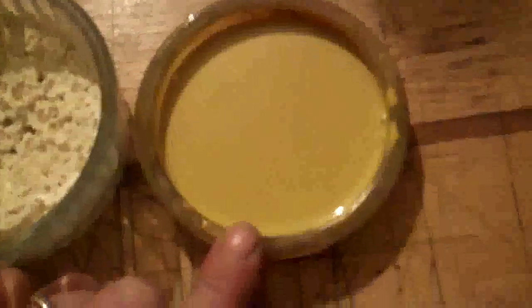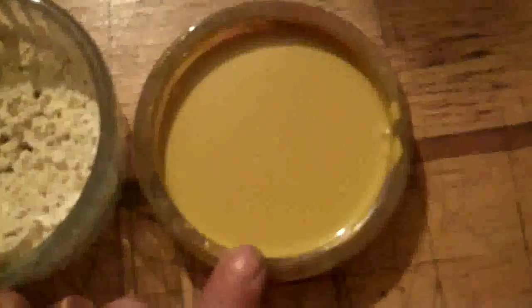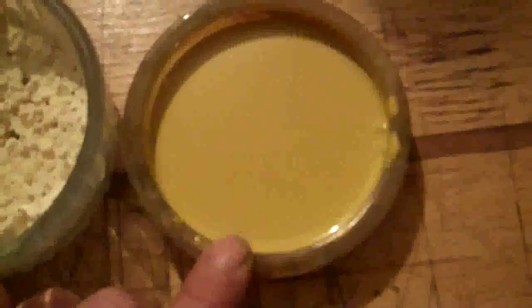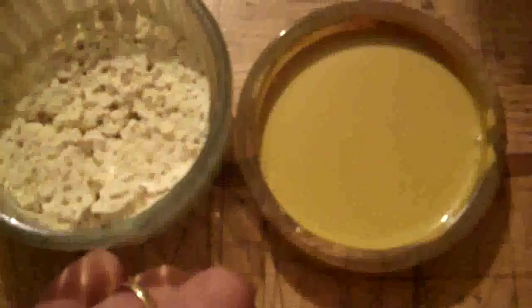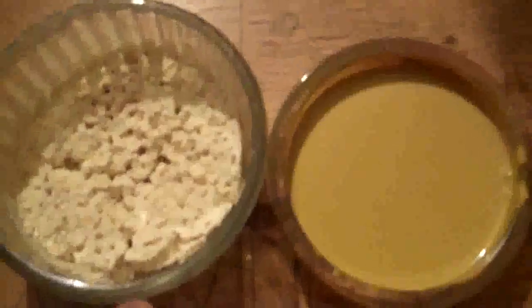You can also dope it, which is what we've done here — doped with iron to get this iron-doped graphitic carbon nitride. We doped it by adding iron(III) chloride in a two-to-one ratio — two grams of iron chloride per gram of carbon nitride — stirred for five hours in acetone, then washed and dried, giving this orange-yellow powder. This is good for hydrogen extraction from water using solar energy: put it in a solar cell, point it at the sun, and hydrogen bubbles off. You can also dope carbon nitride with zinc chloride in ethanol for water splitting, or with nitrogen and sulfur. Two really useful materials that are easy to synthesize and very useful for solar cells and semiconductors.